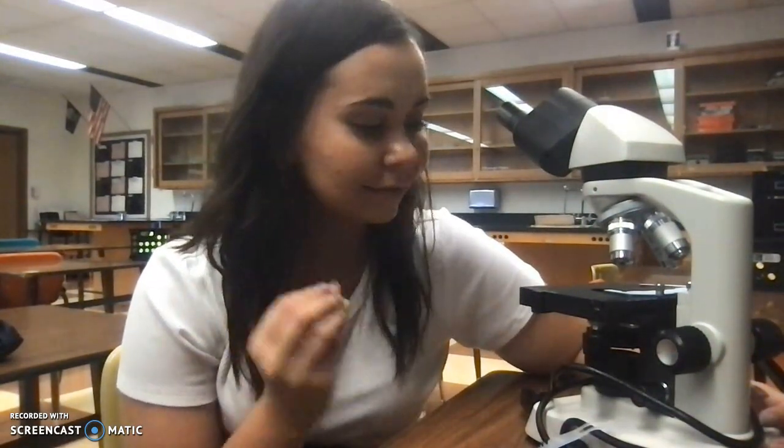Alright, we are going to briefly explain how to use a microscope before starting today's activities. So, advanced biology only gets to use my brand new microscopes. Nobody else. They're my babies. You're going to learn about all of the different parts of a microscope in class today, but we're just talking about some of the rules or some of my pet peeves when using a microscope.